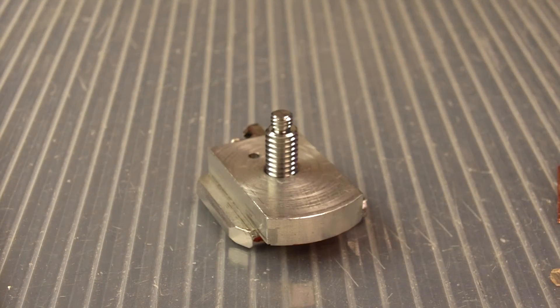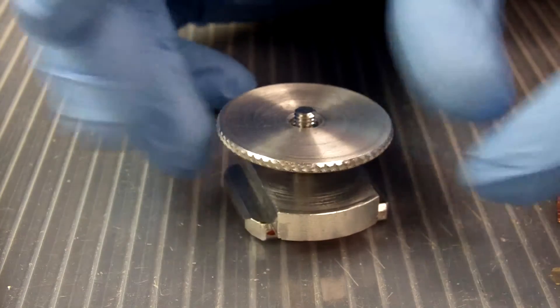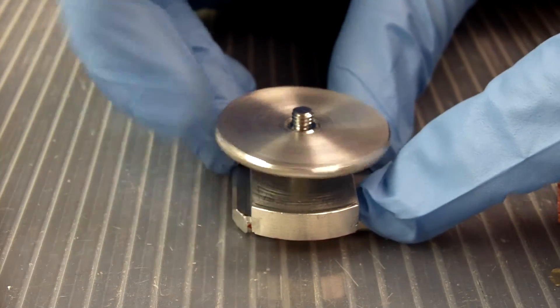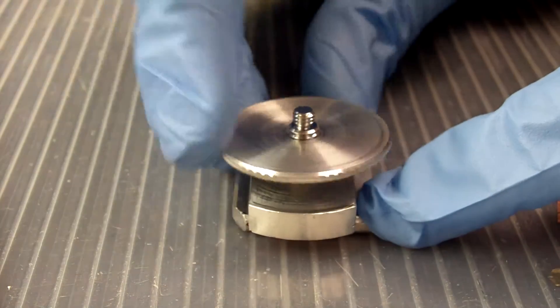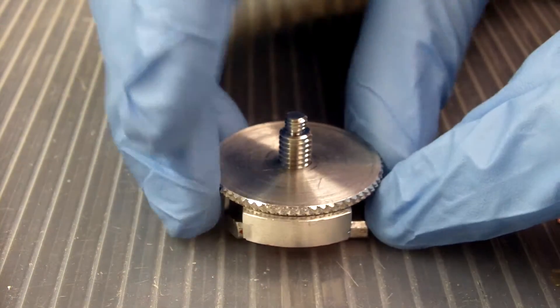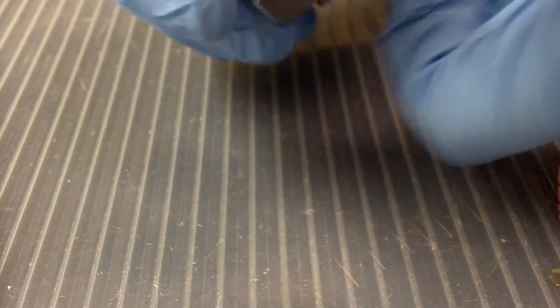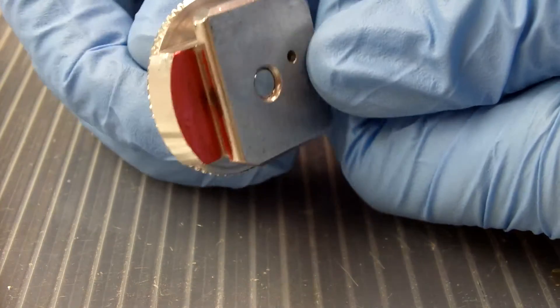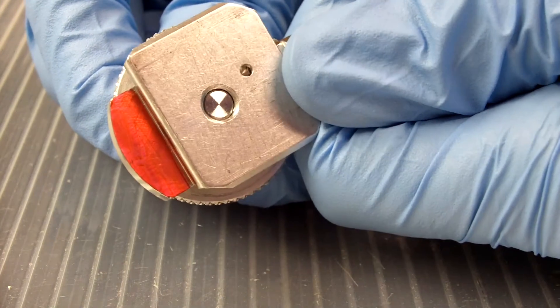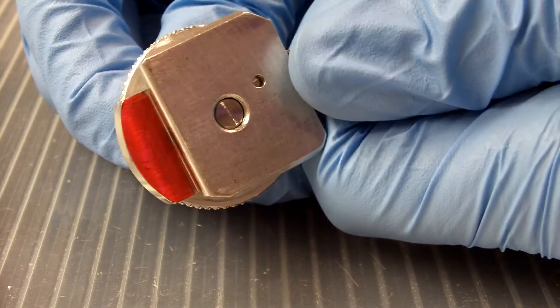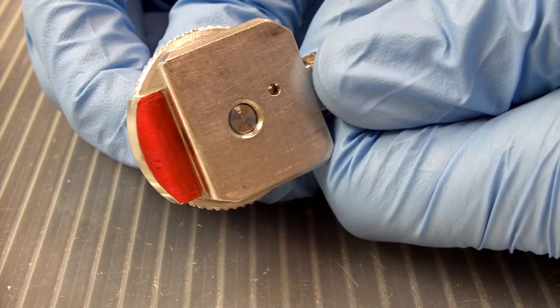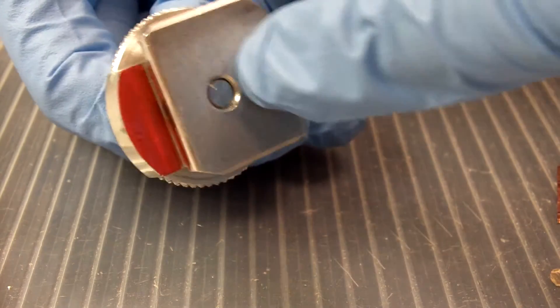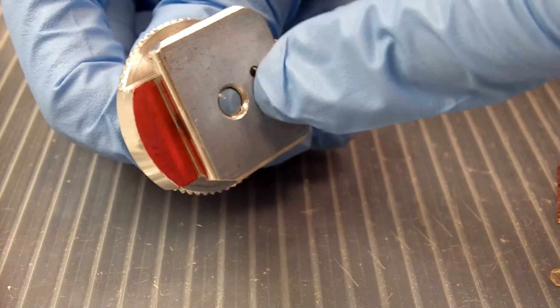What will happen now is when we are putting the locking ring here onto the screw, what is going to happen most likely is we are going to end up screwing that screw in just a little bit in the process of doing this. And then once we tighten the locking ring down real tight, that is going to jam that screw right into the bottom of the base here, right where we do not want it to go and that will get it stuck. And if I didn't make it clear already, we do not want the screw to get all the way to the bottom of this base here. It will get stuck.